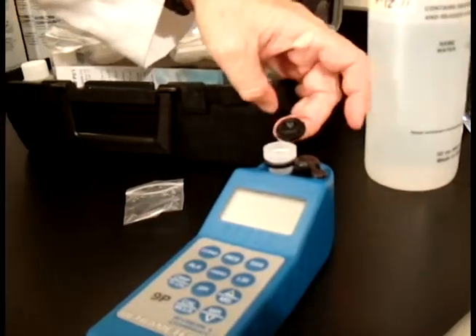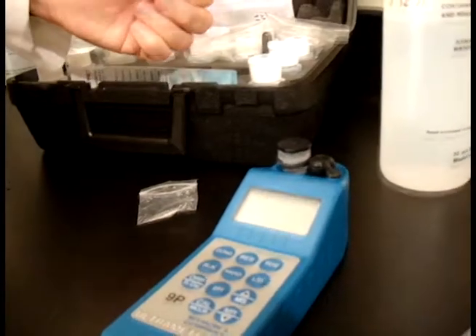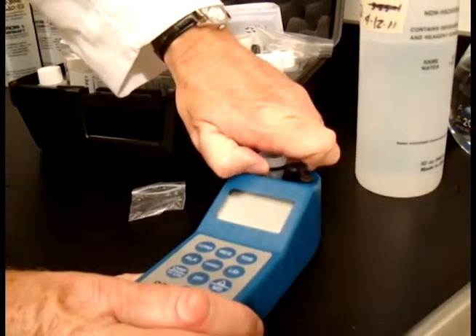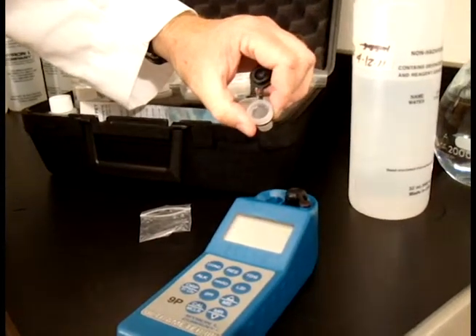And that's really about it. And of course the cap would fit right back on. Now to remove it, simply take both sides of this and just pull straight up — and that's how you remove the cell extender.